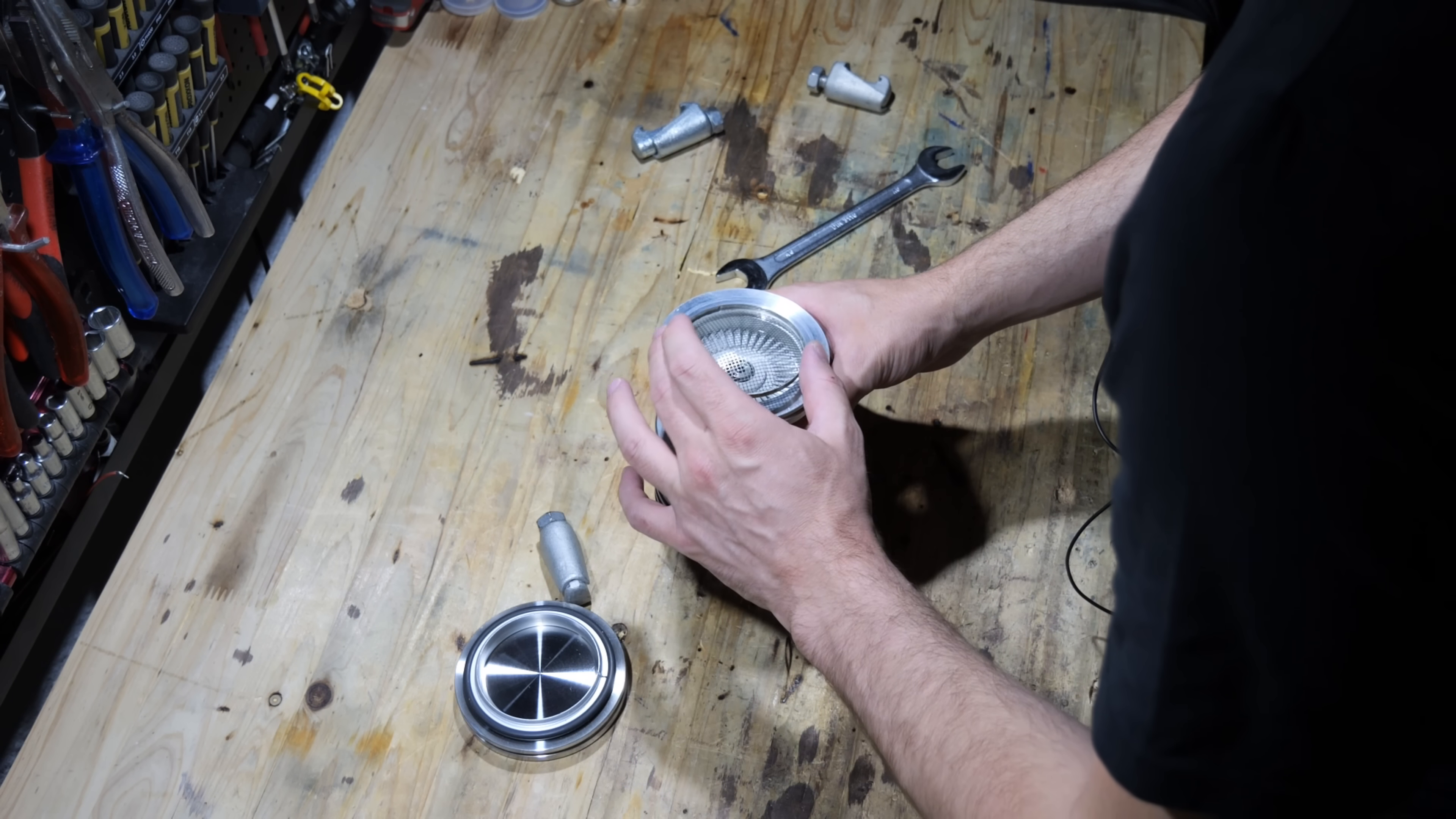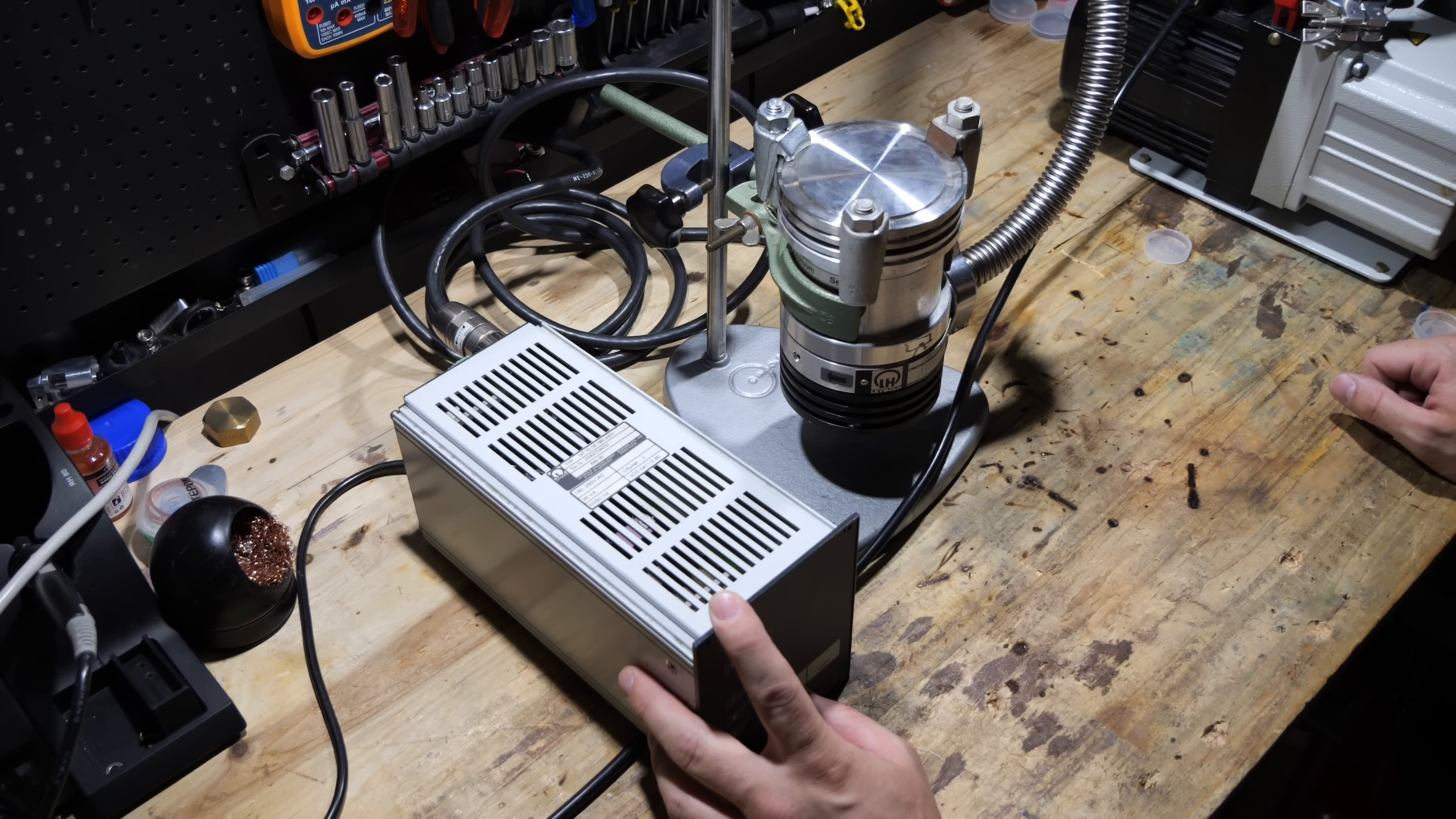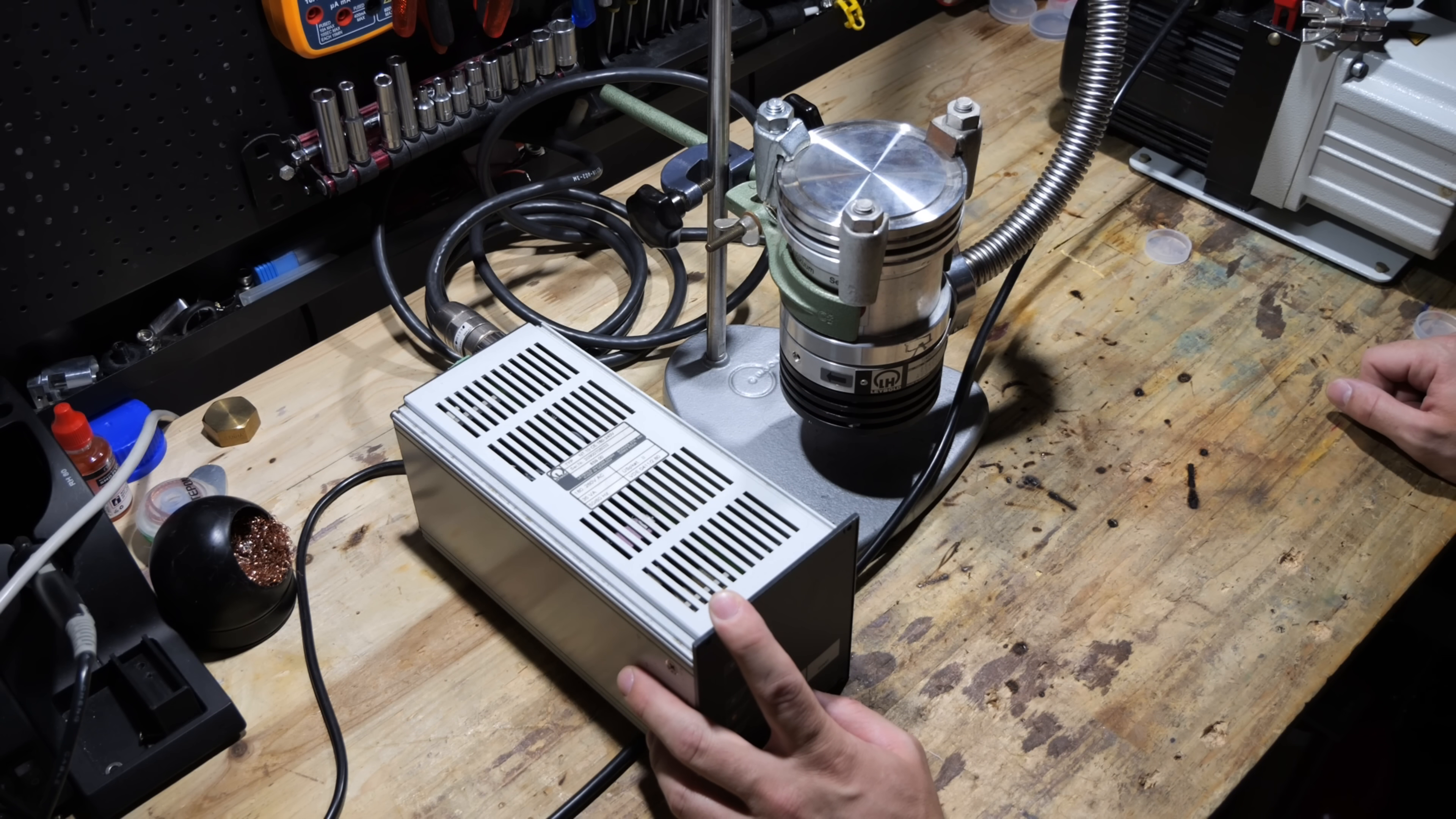Since the rotor was freely spinning I decided to just turn it on. It did not produce any unusual sounds and smoothly reached its maximum speed. However the pump had a lingering odor of old oil reminiscent of a bellow hose that has been connected to a rotary vane pump for a while.